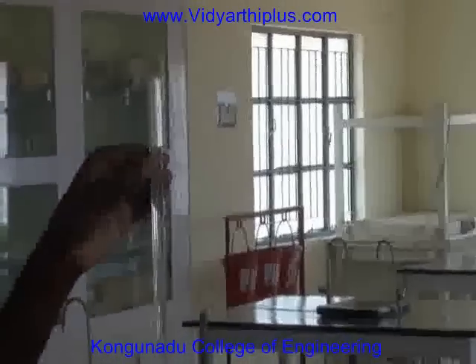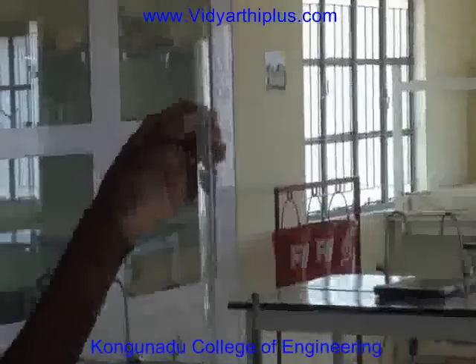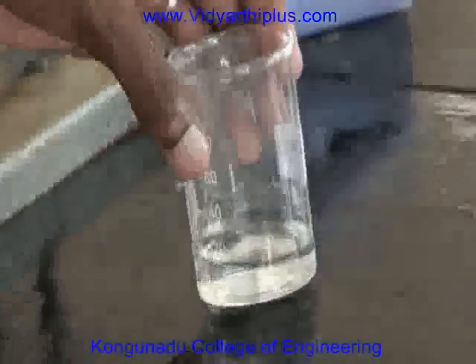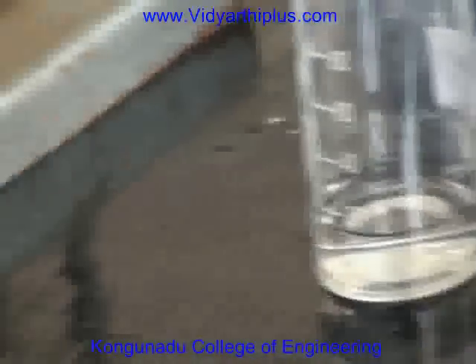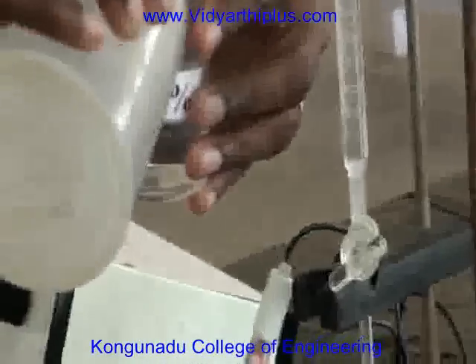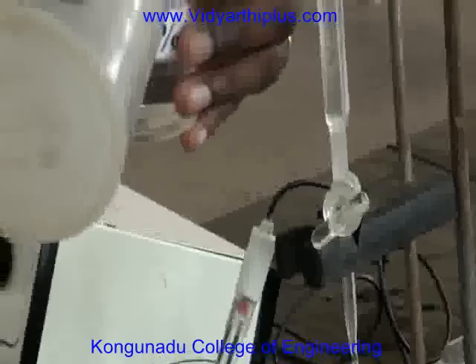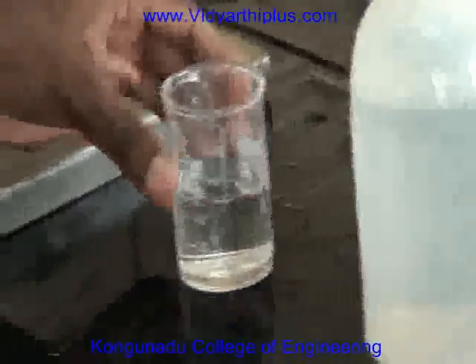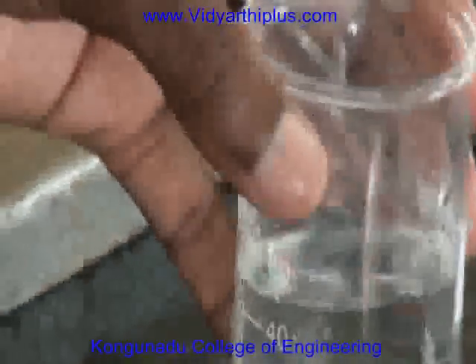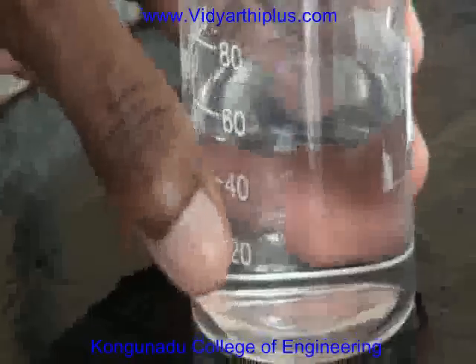The burette is filled with sodium hydroxide solution till the zero mark. For doing the titration, 20 ml of HCl is taken in the 100 ml beaker. Then 30 ml of distilled water is added to make up to 50 ml in the beaker.